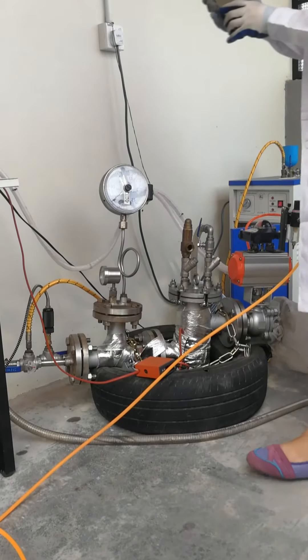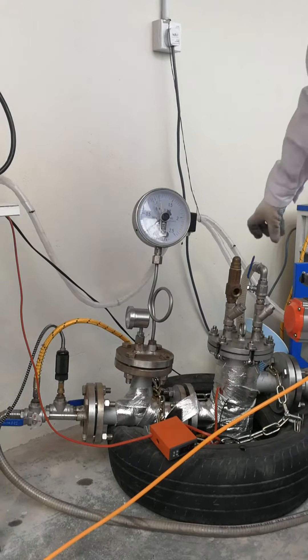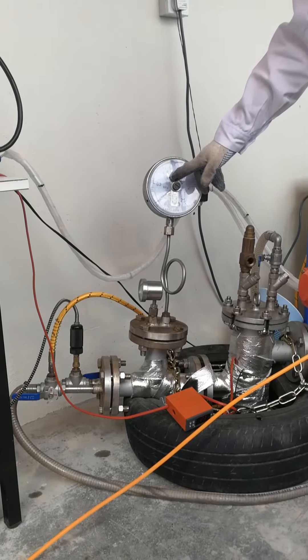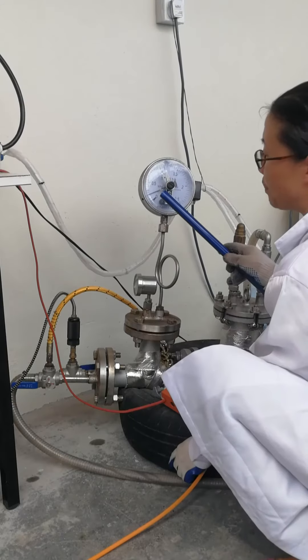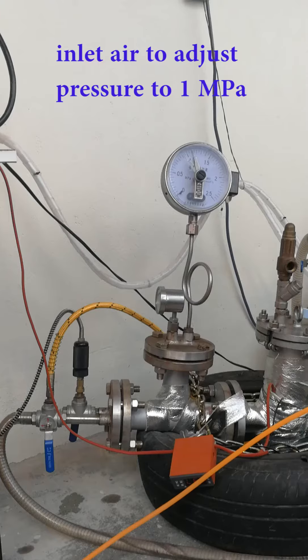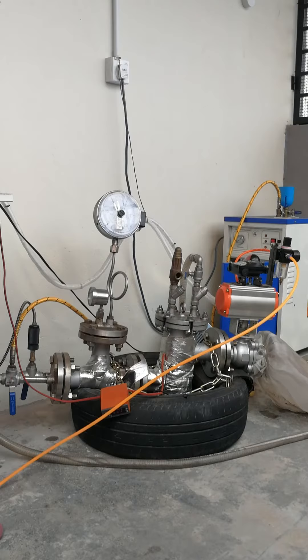When the steam goes out stable, we will record the time. After finishing the treatment, we will close the valve to let the pressure increase. The steam pressure will increase when the system becomes a fully closed system. When the pressure reaches the set point, we will close the steam. The temperature now rises to 134°C. The optimal treatment time is 5 minutes.